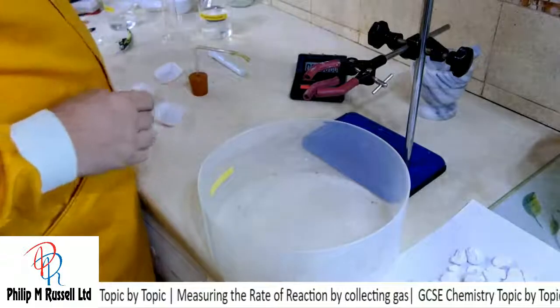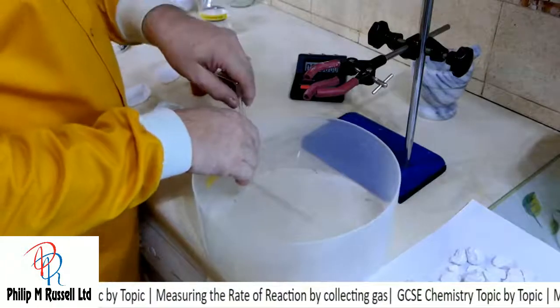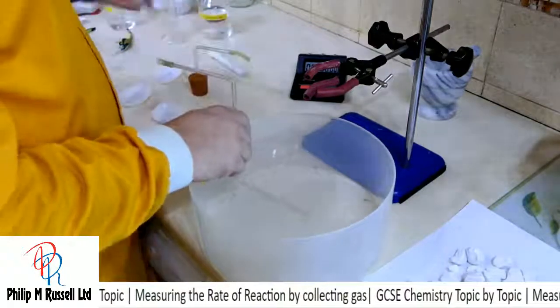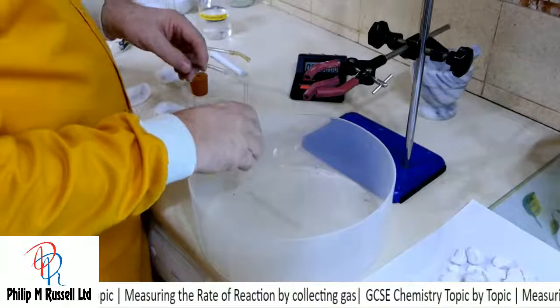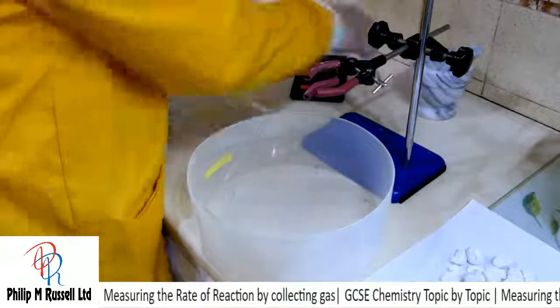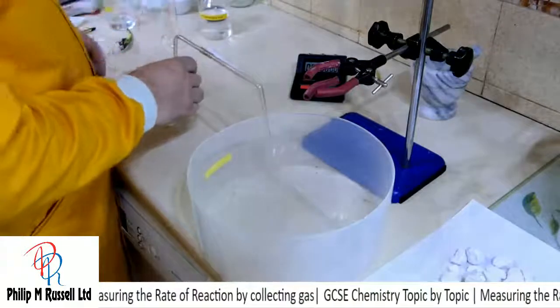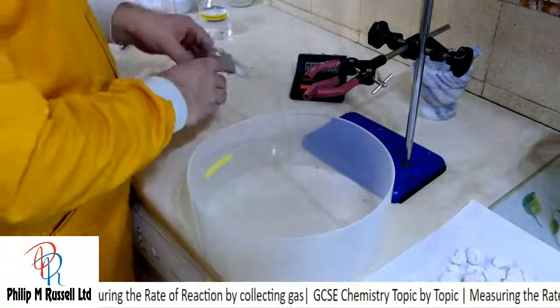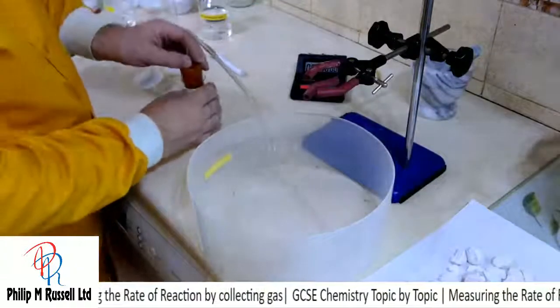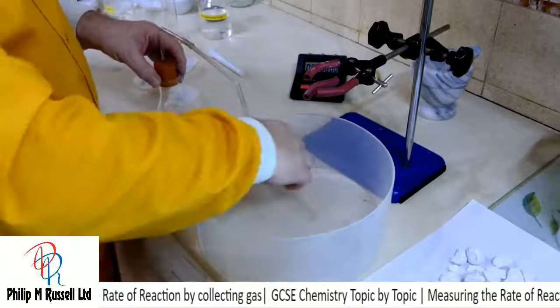I've got a piece of tubing, and what we can do is we can put something over there which is called a beehive shelf, and I didn't get one. And if I just connect this piece up, if all is well set up and organised, then the height of that and the height of that are correct.